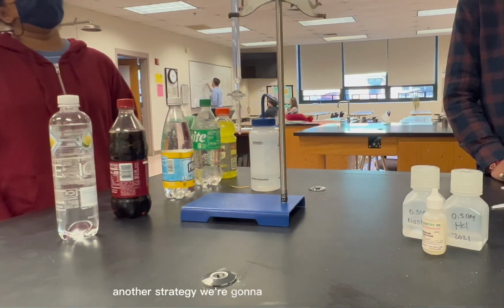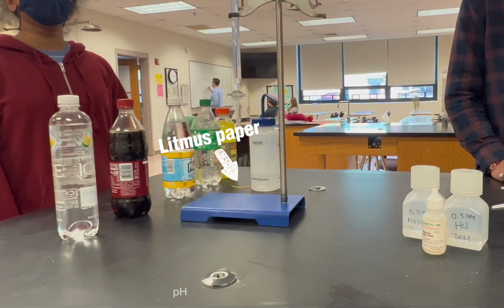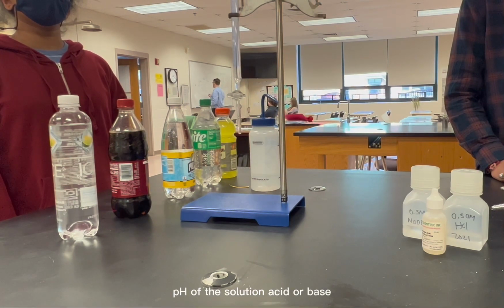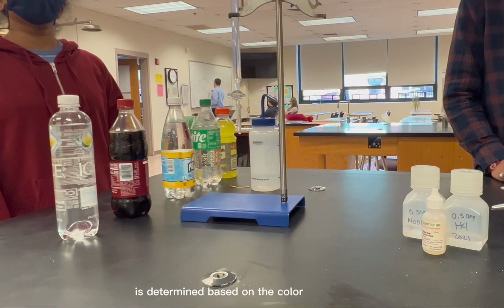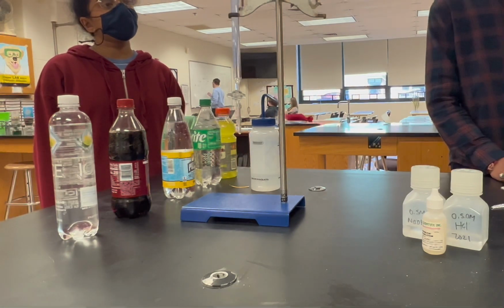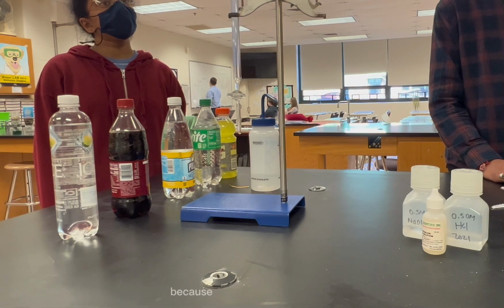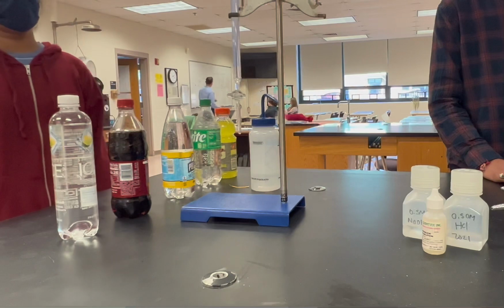Another strategy we're going to be using is litmus paper, which is pH paper. The pH of the solution, acid or base, is determined based on the color of the litmus paper after several drops of the liquid is added to the paper. The litmus paper is only going to be used for Dr. Pepper because it has a very dark color.